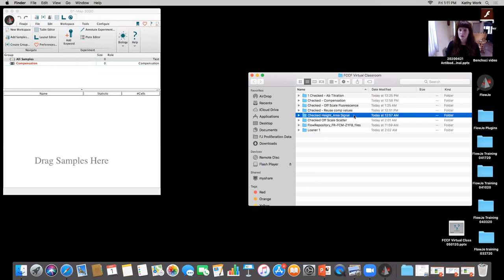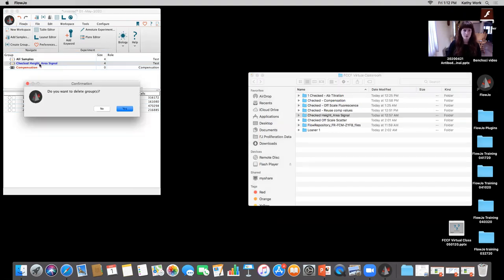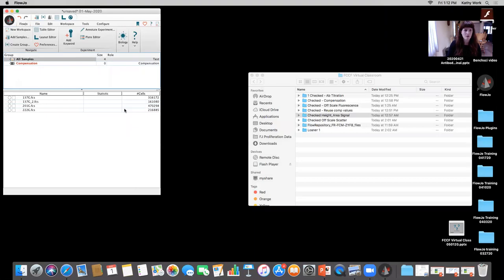Okay, so I'm just going to drag in my first data set, and most everyone will be aware by now, but if you just drag in a folder that has FCS files, it will automatically populate in the workspace for you. And it'll create a group that has the specific name of that folder, and it'll also put those in All Samples, okay? I'm gonna delete that extra group because it doesn't need to be there. And when I hit delete on the keyboard, that's all I needed to do, and those samples are still there, okay?